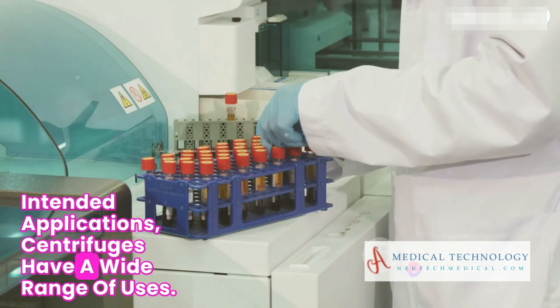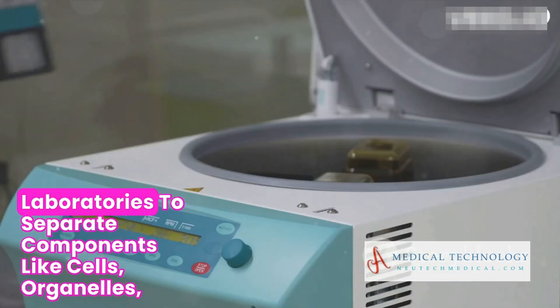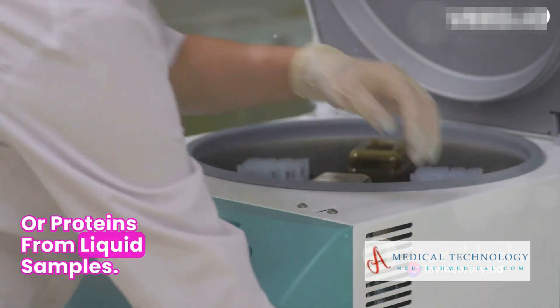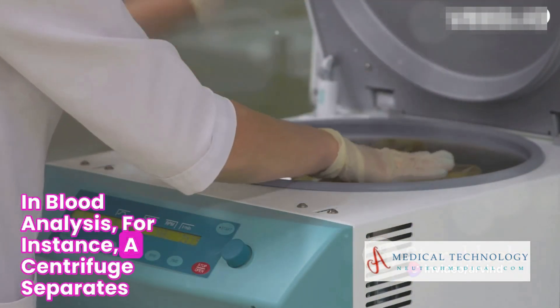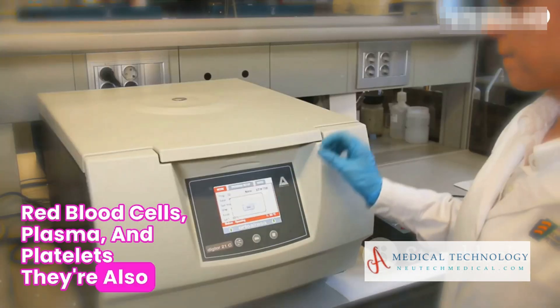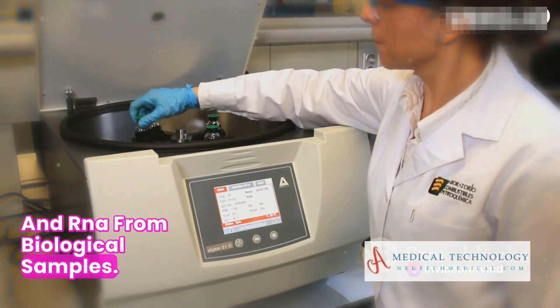Centrifuges have a wide range of uses. They're extensively used in biology and medical laboratories to separate components like cells, organelles, or proteins from liquid samples. In blood analysis, for instance, a centrifuge separates red blood cells, plasma, and platelets. They're also pivotal in isolating nucleic acids such as DNA and RNA from biological samples.